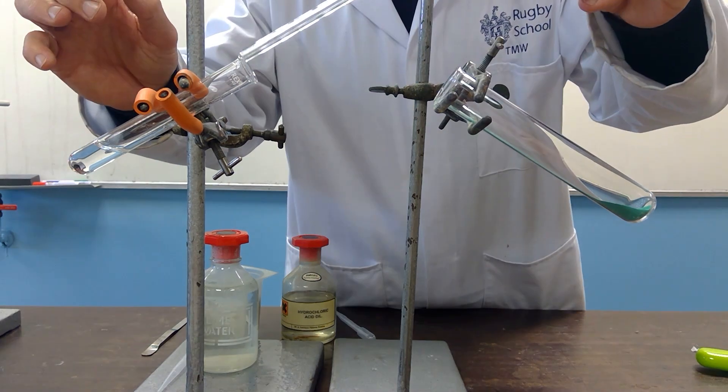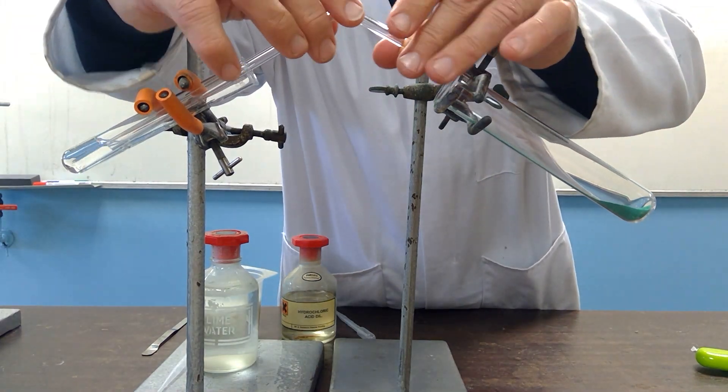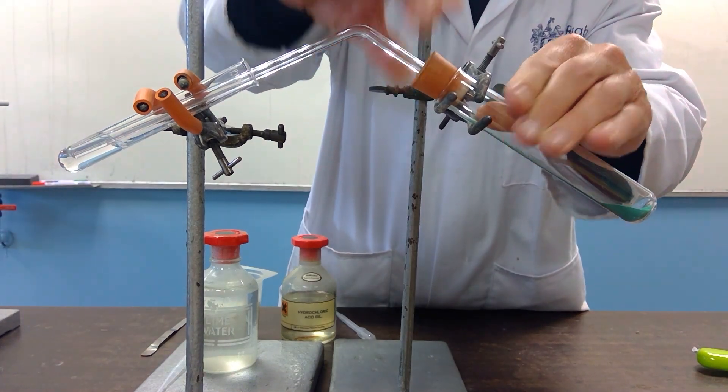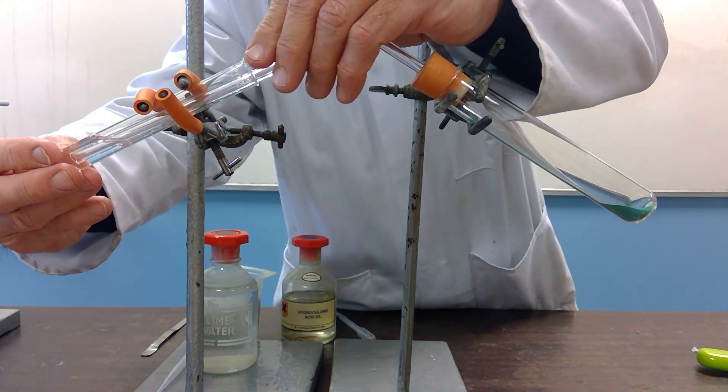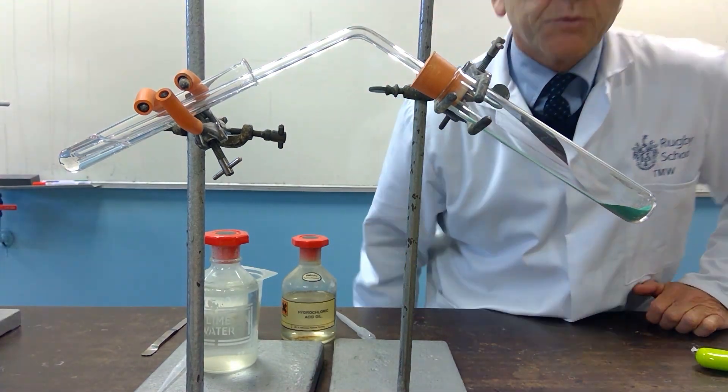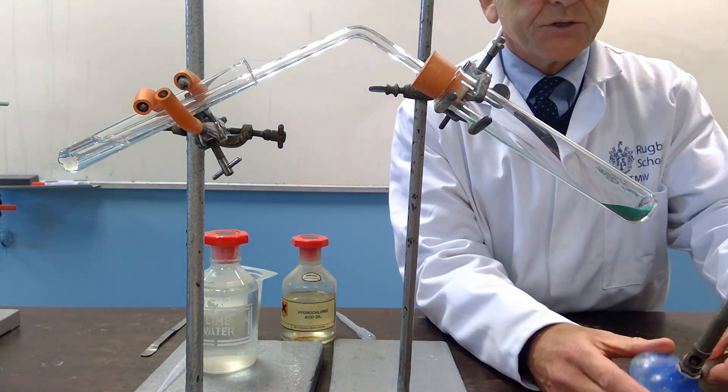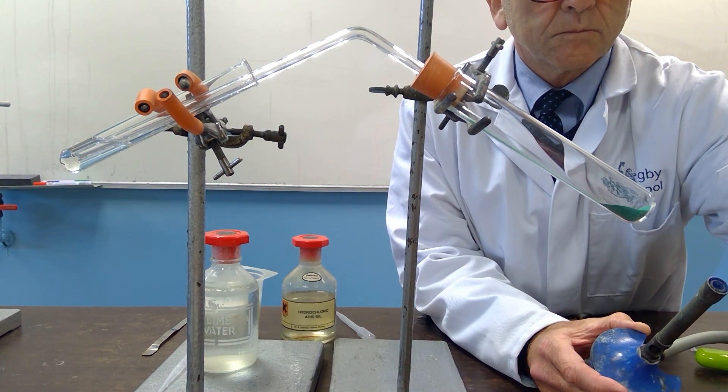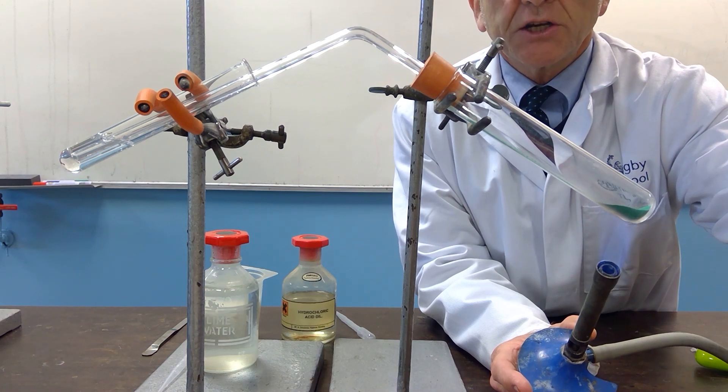If I connect this up with the delivery tube, make sure the bottom of the delivery tube is in the lime water and heat. You will see straight away that the copper carbonate decomposes rapidly. So I'll heat it gently to start with.